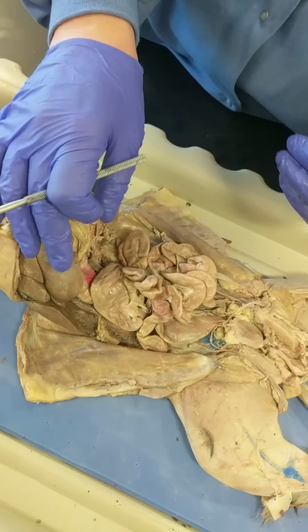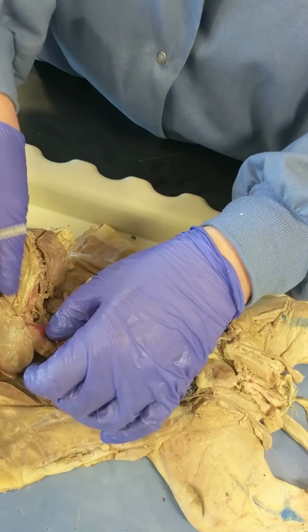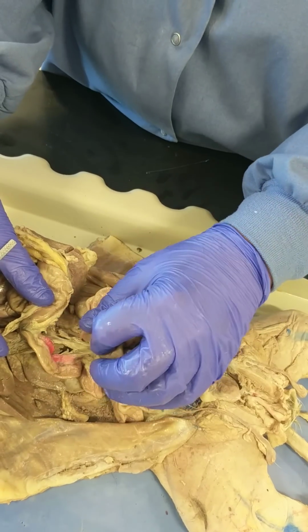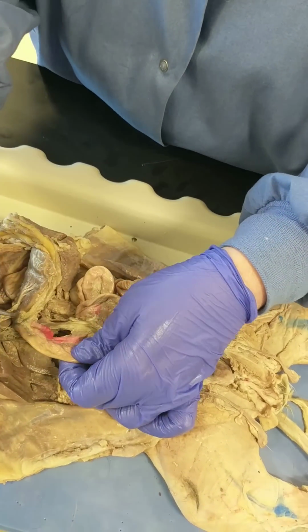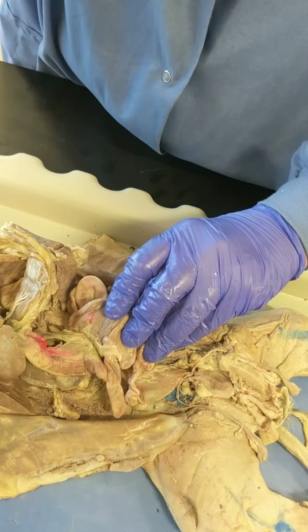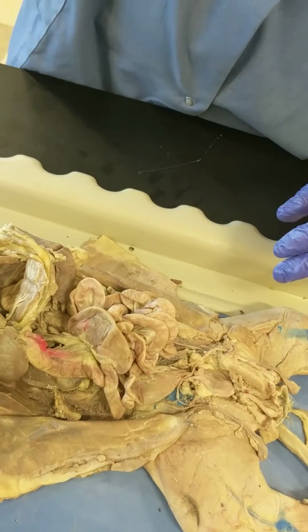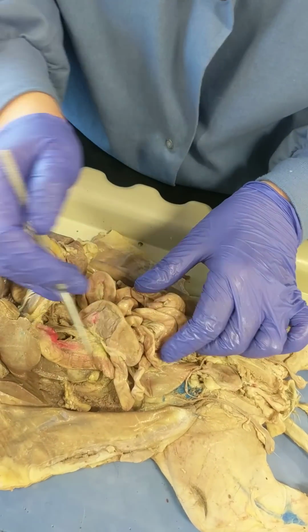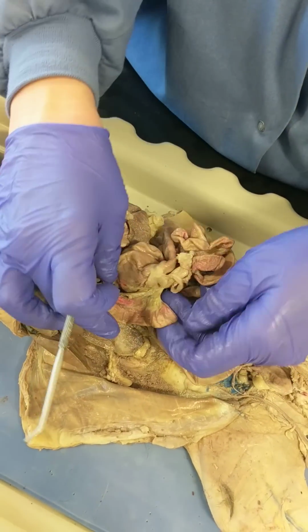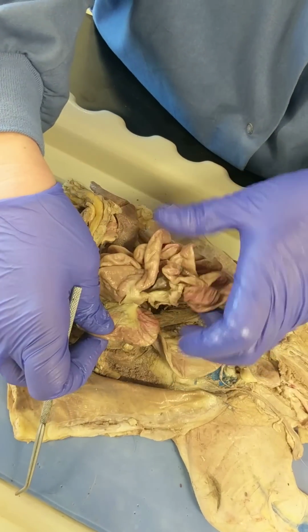Okay, so as far as the small intestine goes, there's 3 regions, and you need to be able to list those 3 regions in order. They include the duodenum, the jejunum, and the ileum. The first is the duodenum, starts right here, and it winds. It actually comes over to this side, and it winds up, and it goes down, it goes all over the place. And then it ends, the whole small intestine ends when it connects to the large intestine.